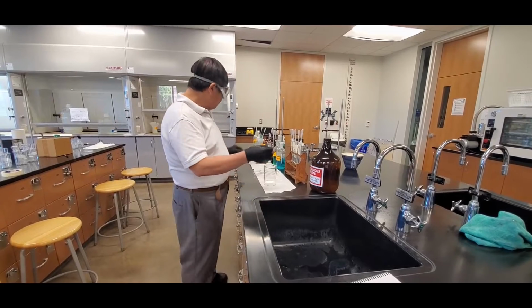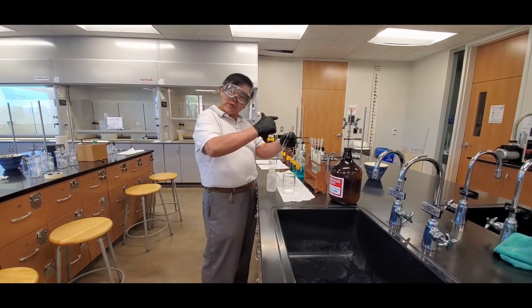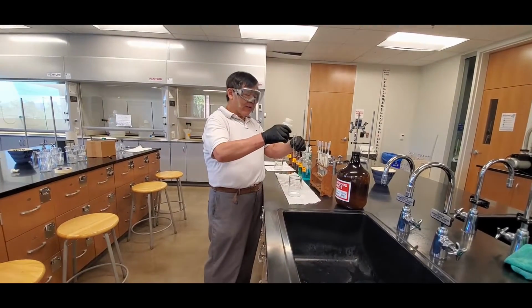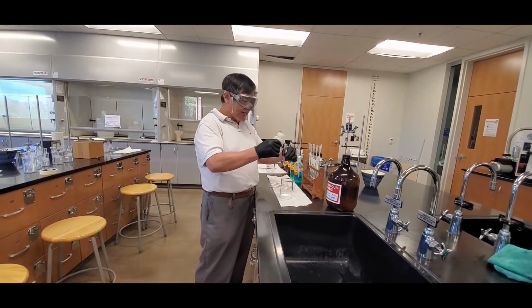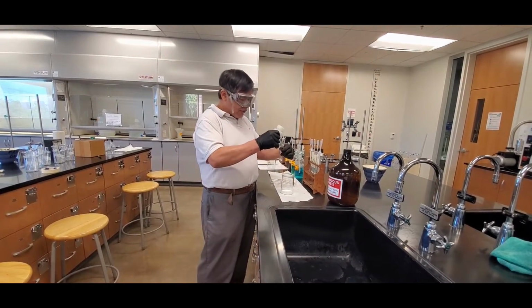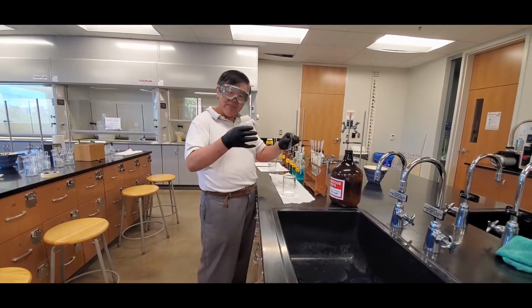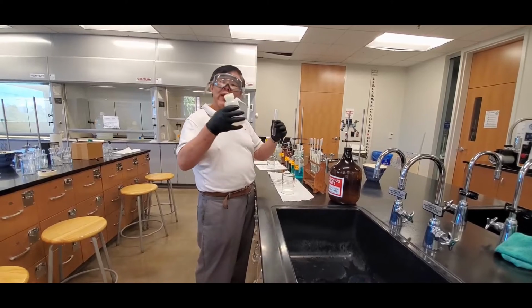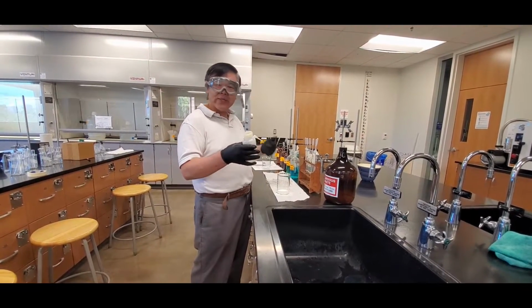Okay, when you're rinsing the tube, don't generate a ton of waste. Don't fill up the tube. Three tiny little rinses are better than one gigantic rinse. So use a squirt bottle, go like that, about 3 times. Usually rinsing 3 times is sufficient. Okay, that's good. So that's how you would rinse your test tube. I'm just showing one, but I'm going to do the rest later.